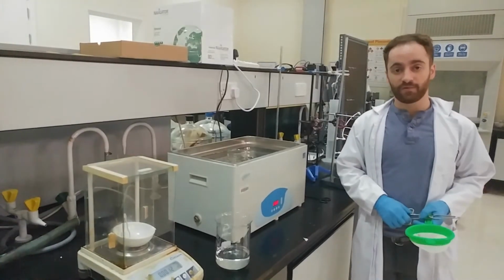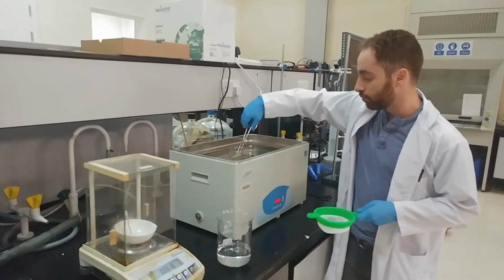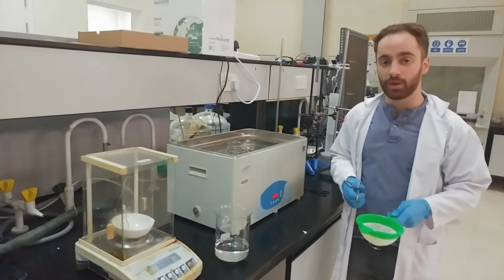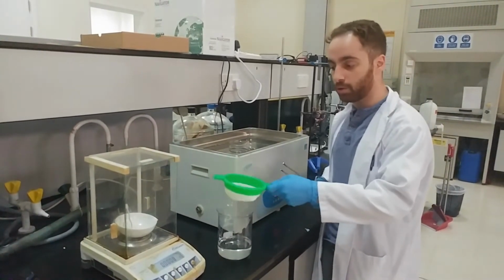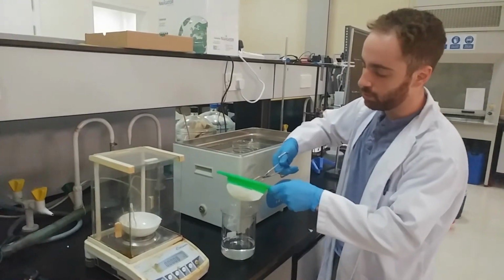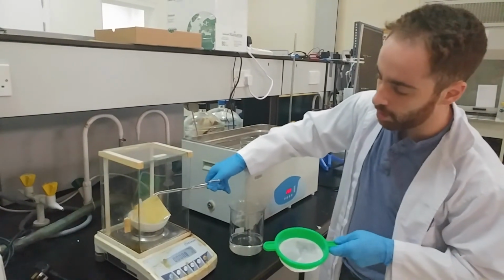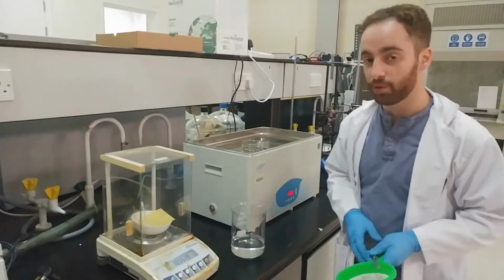Once the time had finished for a certain trial, the piece would be removed. In cases of high temperatures, the piece would first have to be strained over a beaker so that excess water may be removed. Afterwards, the piece would be placed on the scale and the new value would be recorded.